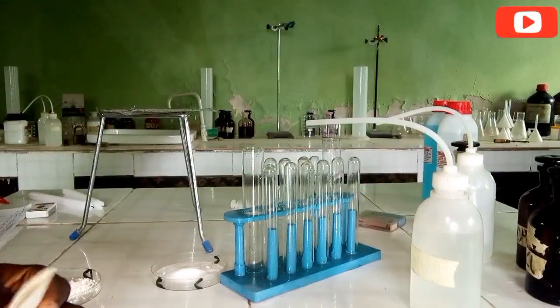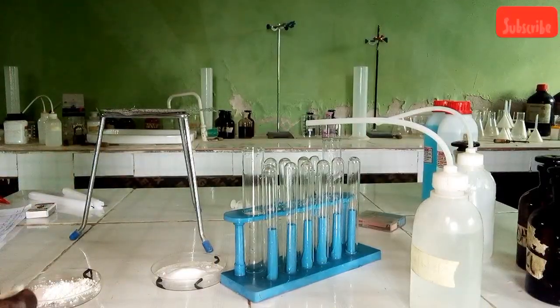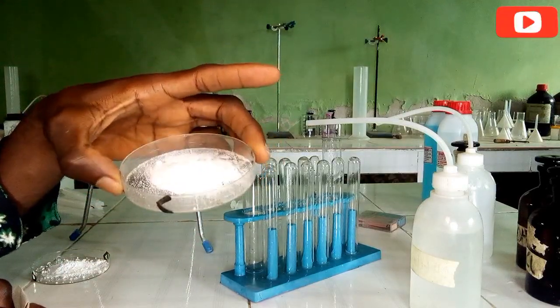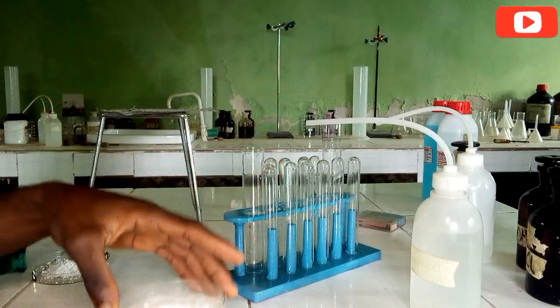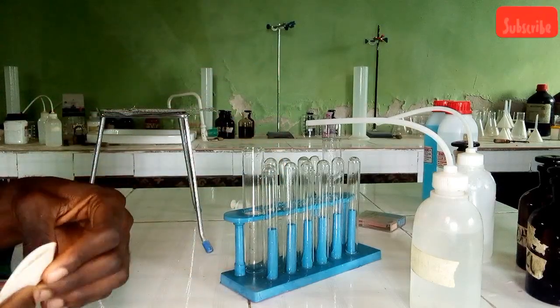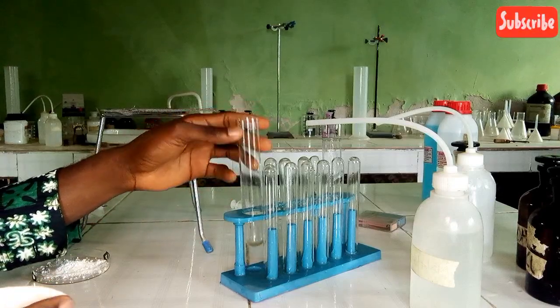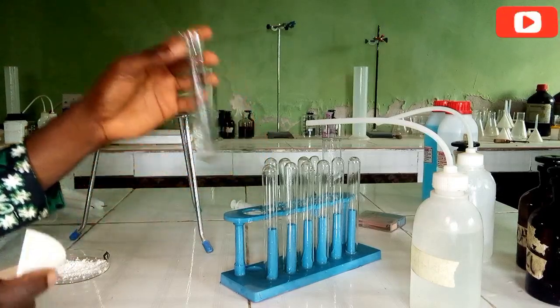Okay, now let's look at the experiment. According to the first step for sample C, so this is sample C now. We have seen it labeled C. We are told to add a few centimeters into a test tube, and then we add a few centimeters of water.